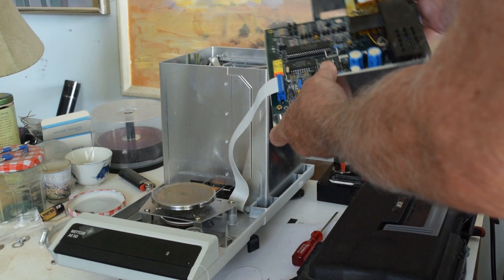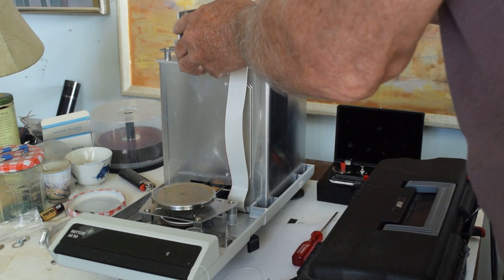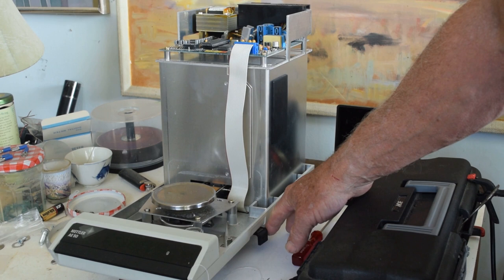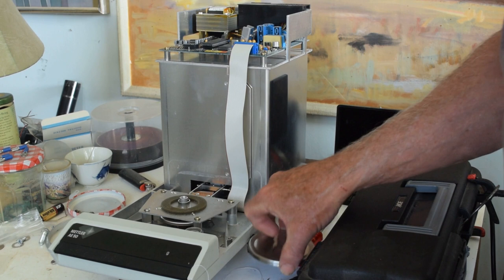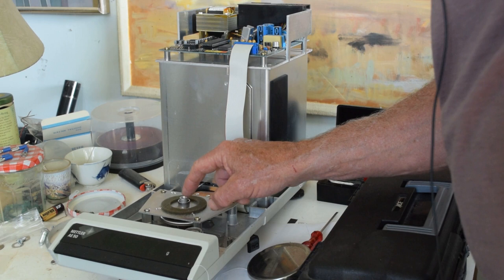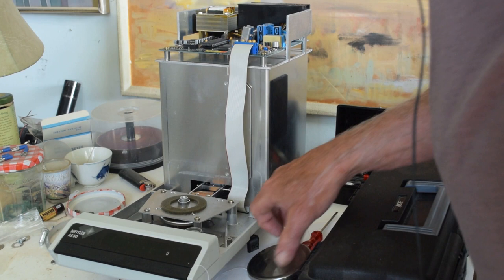Now I do my own calibration. This is the calibration weight, and if you look down there, you can see that when you do this it drops the weight onto the pan underneath. You also have to make certain that this plate here is not rubbing — it can move sideways and there's really nothing holding it — so make certain it's not rubbing on the side.